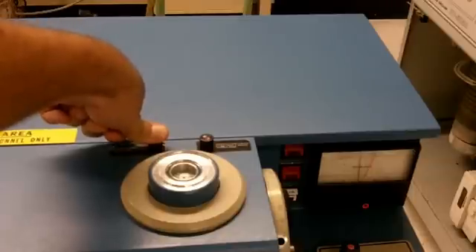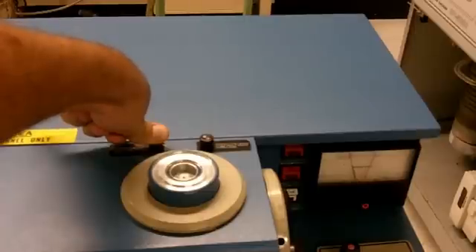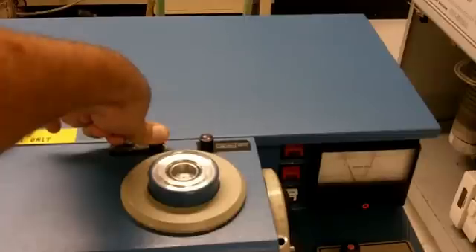Now I am holding it down, and as you can see, the pressure is slowly going down. When we reach our desired pressure — I am going to pump it down to 50 millitorr, or around there — we can lower the unit down into the work chamber area.